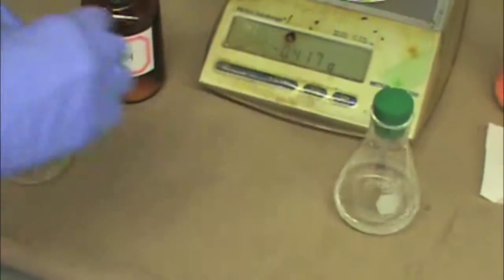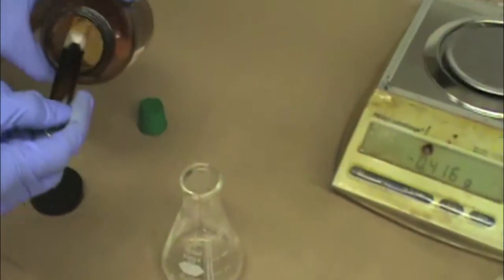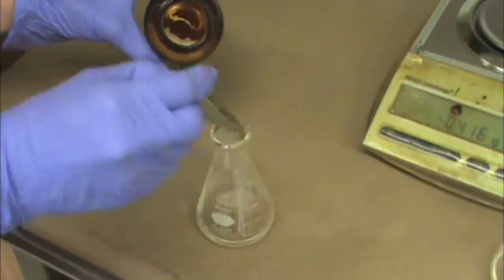In the second sample, it contains a bit more water, so we will need a little more sodium sulfate. Uncap your sample and start by adding one scoop of sodium sulfate.